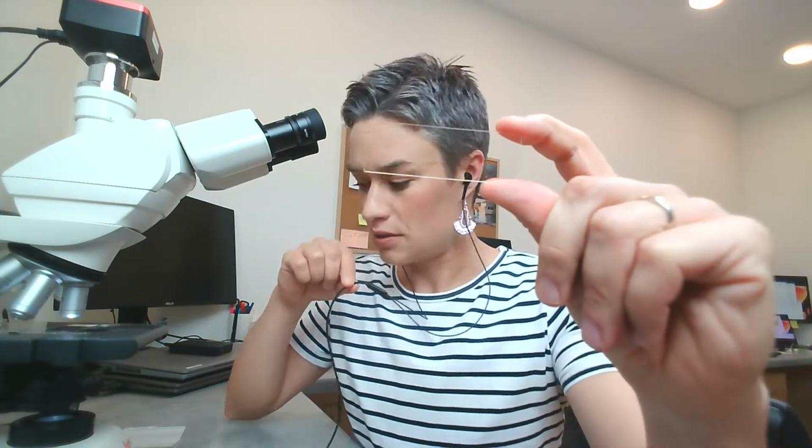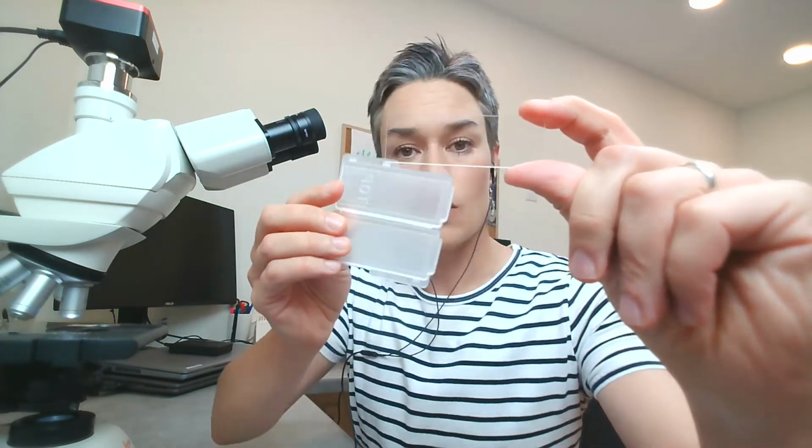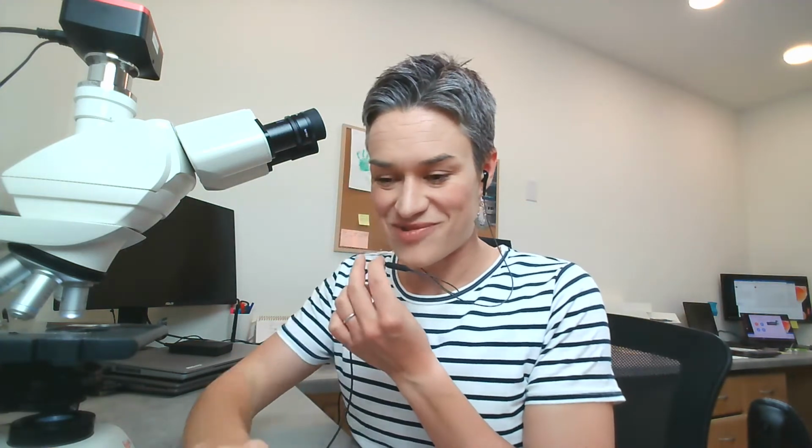One thing that I want to mention is before we start measuring anything, we have to calibrate our microscope. And Mike, maybe you can talk about it briefly. And we have a video. The only thing I want to show is that we need a special slide for this. So if you could say a couple of words and then we can move to the measuring part. Yeah, sure. So the special slide you're talking about is called a stage micrometer.